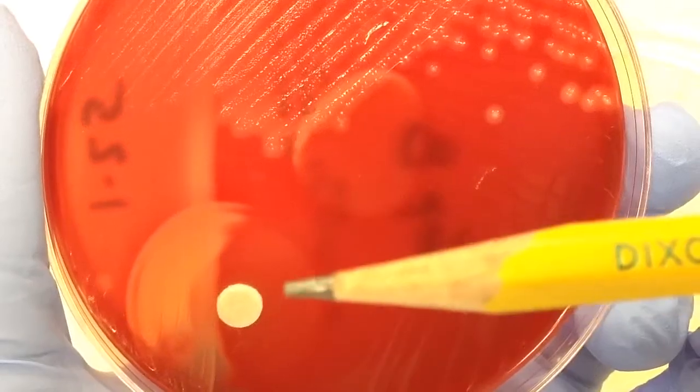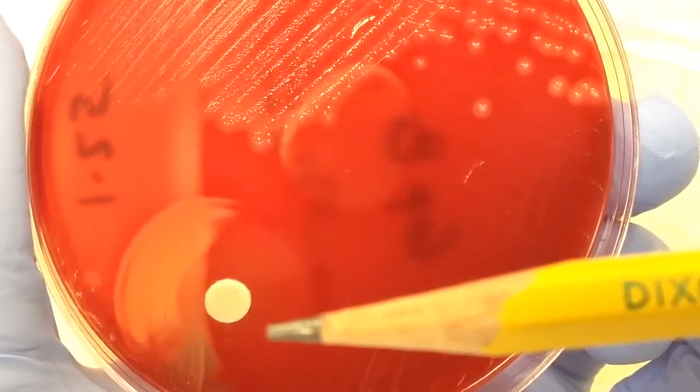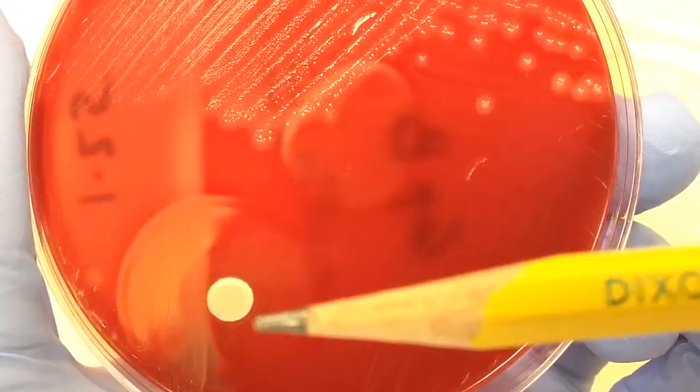What you do is, this is the CAMP disk, and you put it next to, but not quite touching, where the organism is.